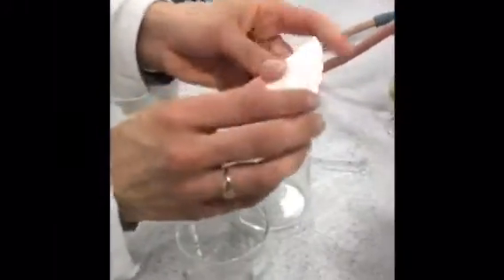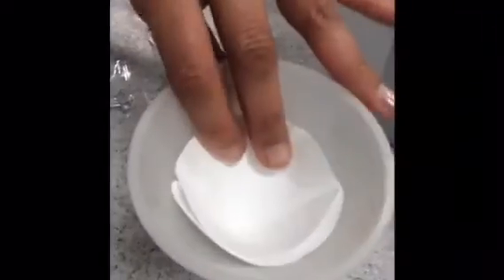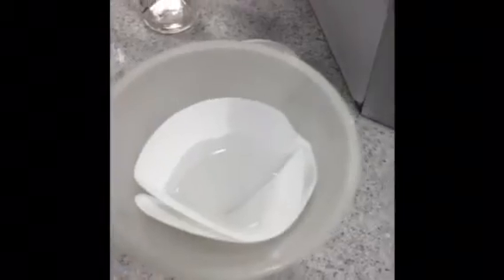Once all the salt has dissolved in the water, we're going to re-filter that using the filter paper. Fold it in half, fold it in half again. Pour that through and we're now going to collect the filtrate which will have pure salt crystals.